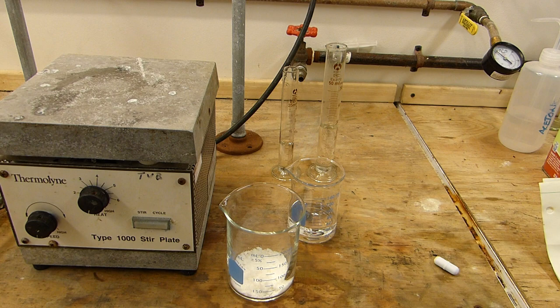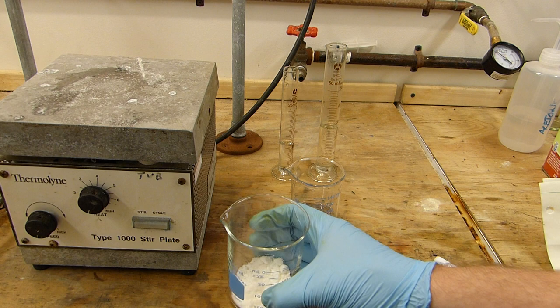So let's get to the lab and start doing it. I've set up for this reaction by placing 26.2 grams of solid potassium iodide in the bottom of a 200 milliliter beaker.